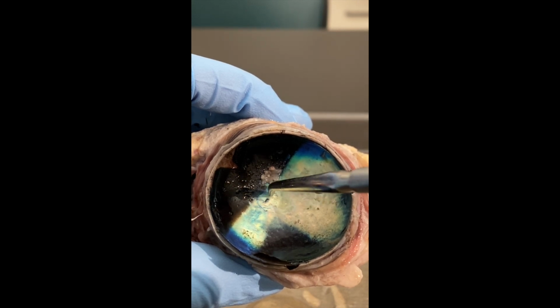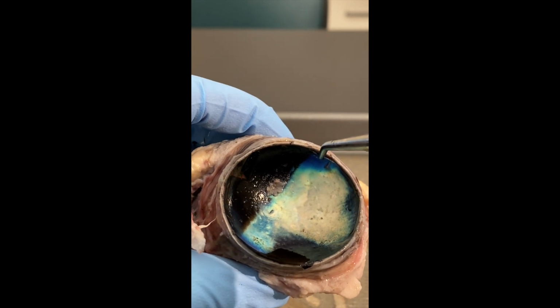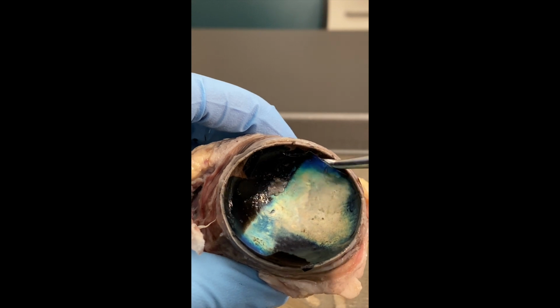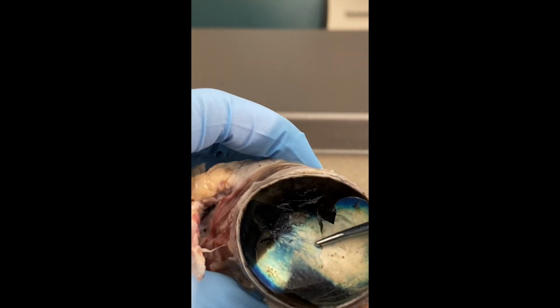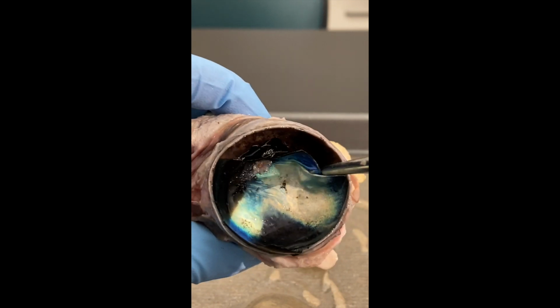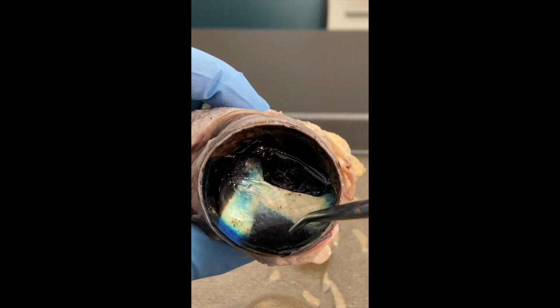This is where you're going to find the highest concentration of cones, so that's how you get your visual acuity. Now with the pigmented layer of the retina on the opposing side, if we taco this over, you're going to see this blackish brown coloring.